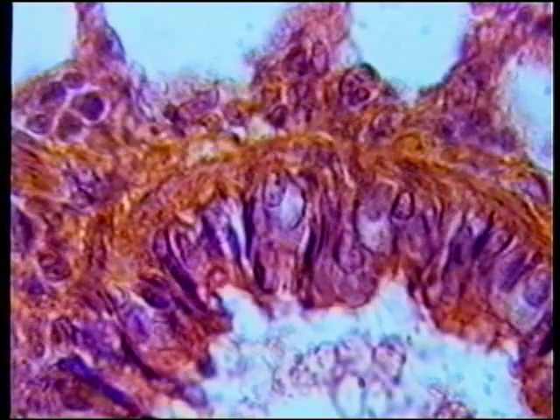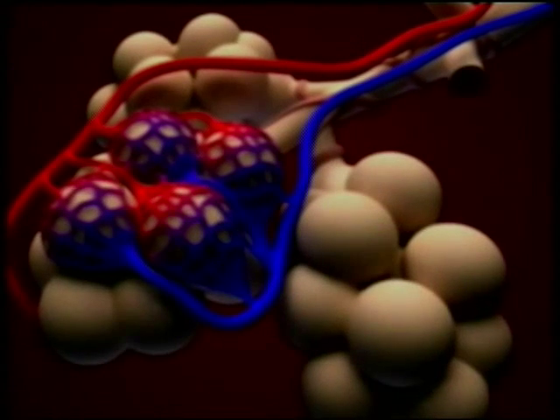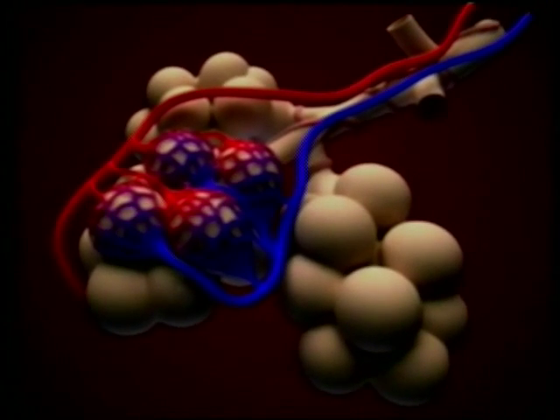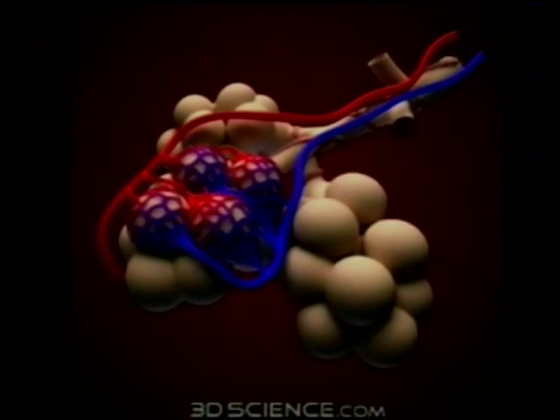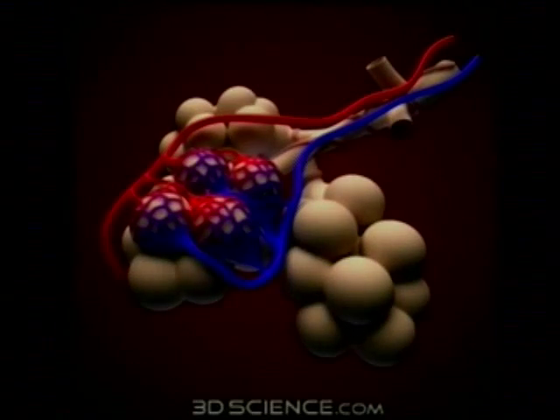Here we see a blood vessel in lung tissue — that would be the space where blood travels through. As we pan up, we see some of the lung chambers. These ring-like pieces of tissue are what you get when a hollow sphere is thinly sliced. When we inhale, that space is filled with air, and the oxygen in that air diffuses through the wall of the lung and then through the wall of the blood vessel into the blood.